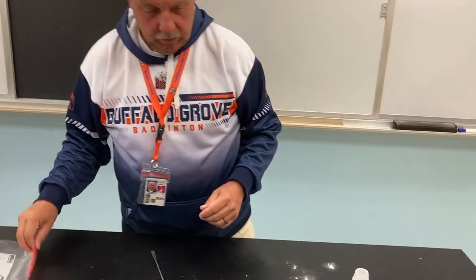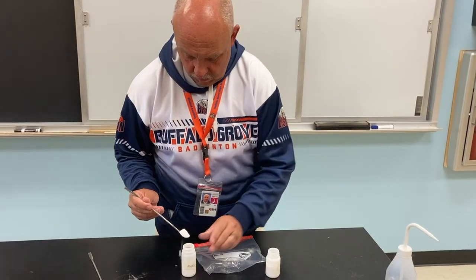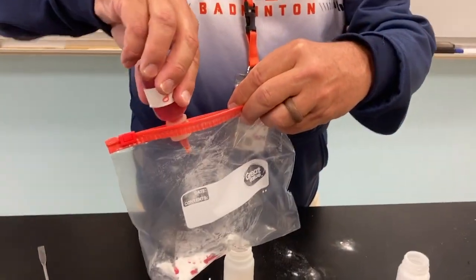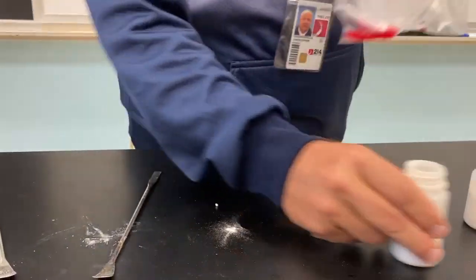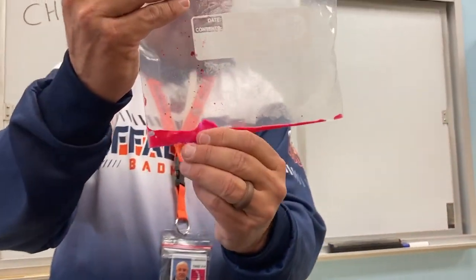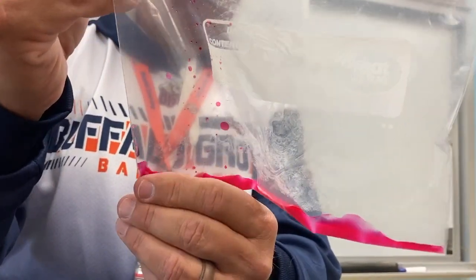Let's see what happens with the sodium bicarbonate. Oh yeah, good heaping amount there. In goes the phenol red. Now remember, as you're watching this, you might see a color in there, but that's not a color change. Remember, phenol red is red. So if it remains red, we're gonna say there is no color change. Looks like it's still a reddish color. It is getting colder though. Any bubbles? I still don't see any bubbles.